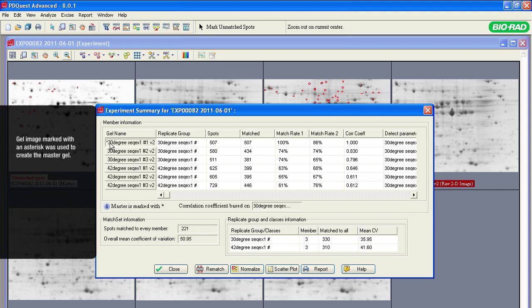Notice that one gel image is marked with an asterisk. The marked gel image was used to create the master gel image. To create the master gel, PDQuest software made a virtual copy of the marked gel and added detected spots from all other gels in the experiment. Therefore, all the identified spots on this gel are included in the master gel. The spots column shows how many spots were detected in each gel. The matched column shows how many matching spots were found on each gel.